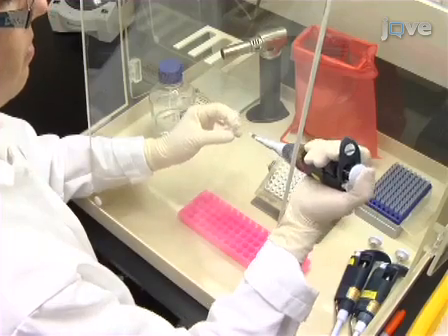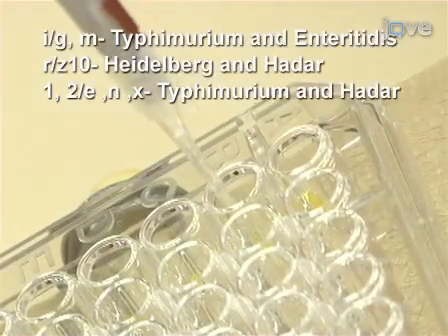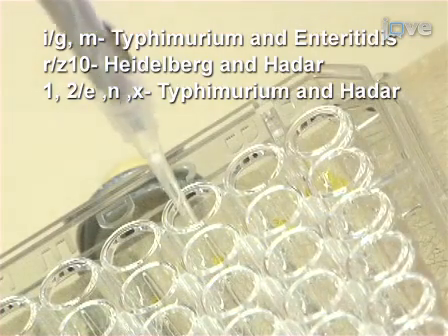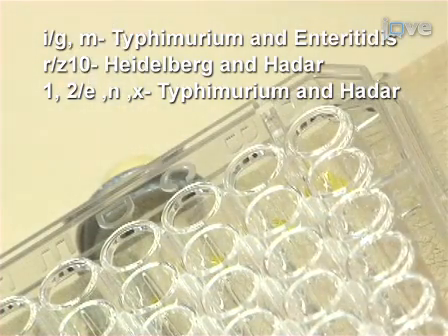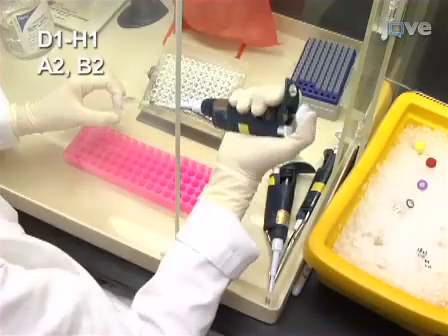Then, dispense 0.5 microliters of the positive control templates to the PCR mix in the second well, and 1 microliter of E. coli K12 DH5 alpha to the third well. Add 1 microliter of the thawed sample template to the remaining wells.